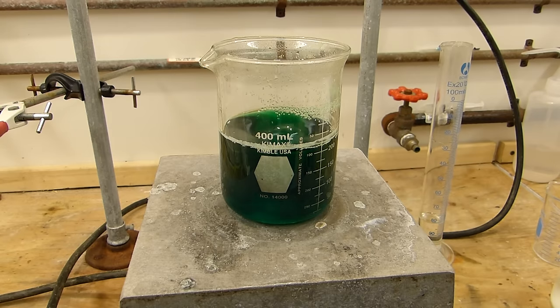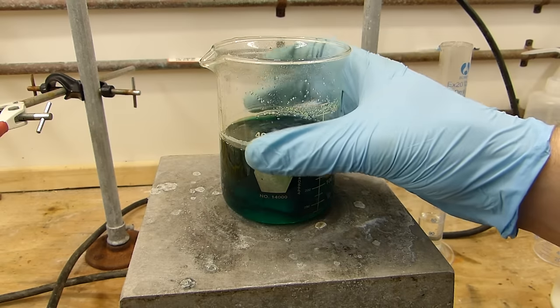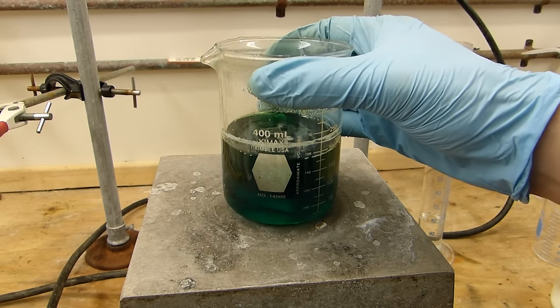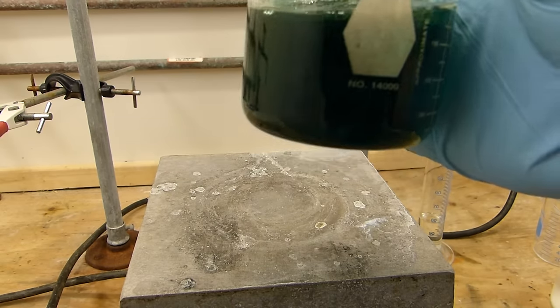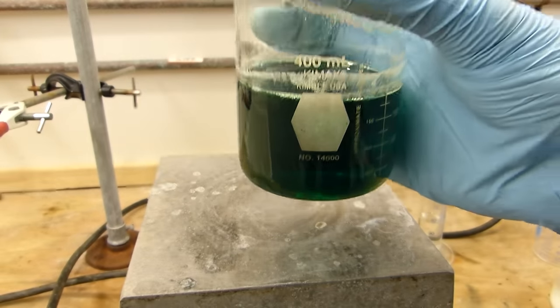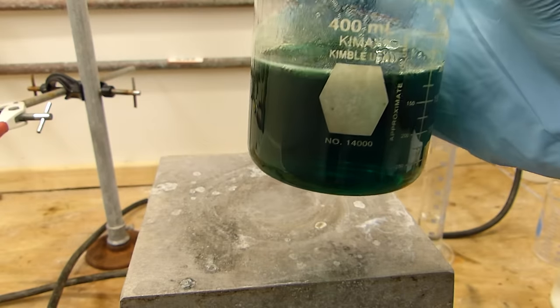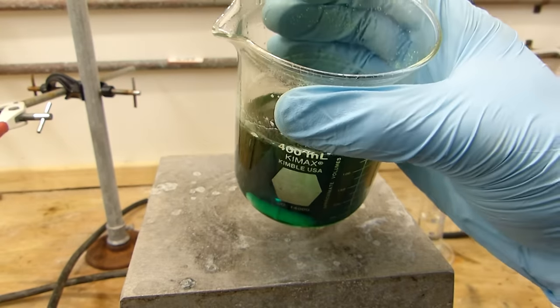So I've stirred this for approximately 10 minutes and I'm going to turn stirring off now and allow the impurities that were in the basic nickel carbonate to sort of settle out before I transfer this to the actual reaction vessel. You can see it's very dark but pretty much transparent right now. I'll let all the sand settle to the bottom. It looks almost like green jello like you might want to drink it but definitely don't.